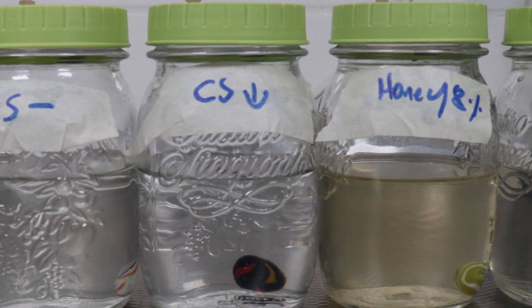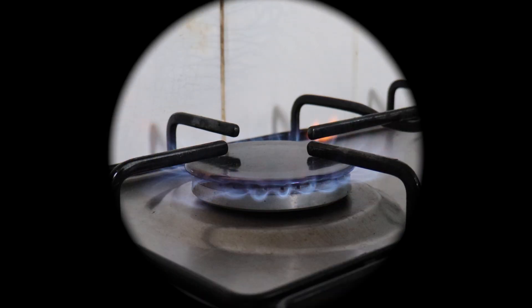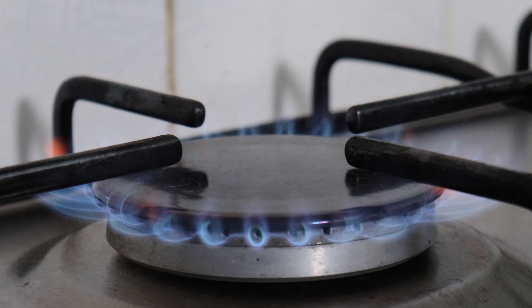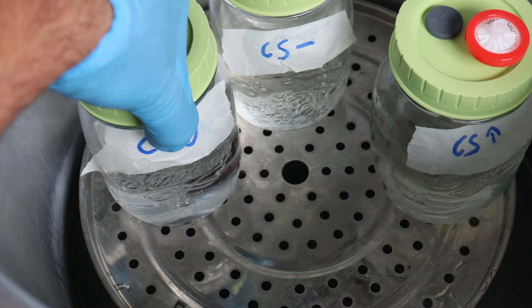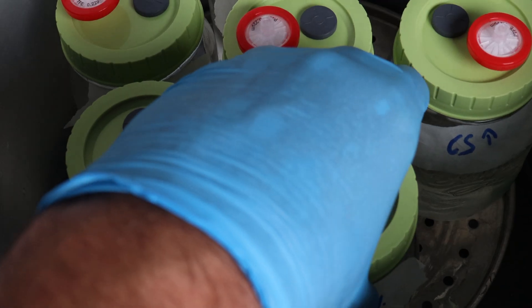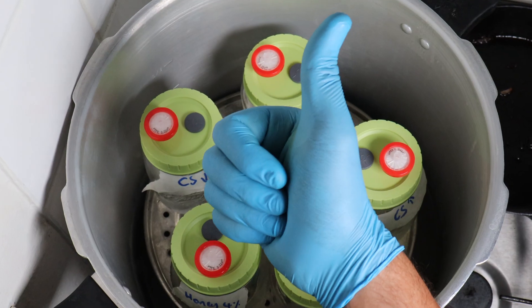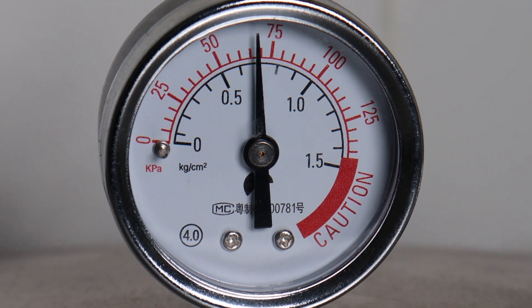And there they all are ready for sterilisation. The time has come to sterilise these cultures in your pressure cooker at 15 psi for about 15 minutes. Don't want to go any longer than that, otherwise some of the sugars may caramelise, which isn't what we're after. So 15 minutes is plenty of time.